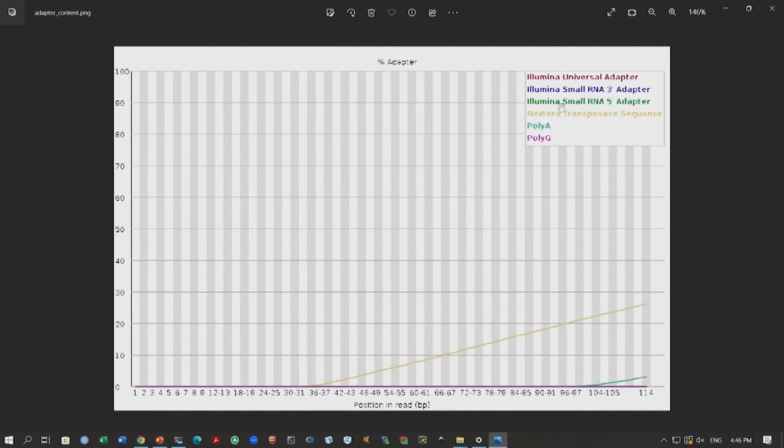So, this color yellow means we have Nextera transposase sequences, right. So, during preparation of this library, this Nextera transposase adapter was used. So, this appears in the read data, right. We have discussed why adapter contamination happens, what the issue is. This happens when the fragments generated from the genome are small, right, and the sequencing process will go into the adapter sequence.